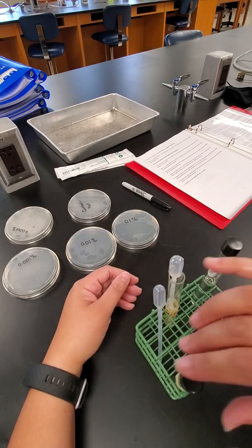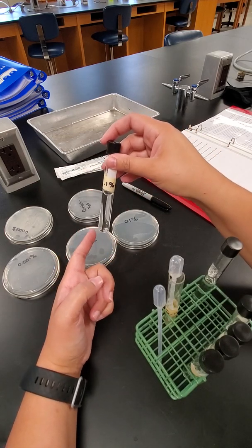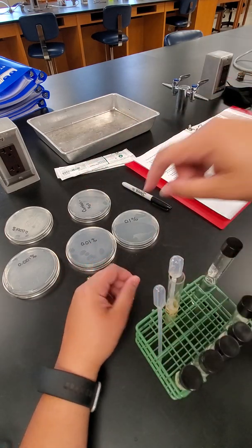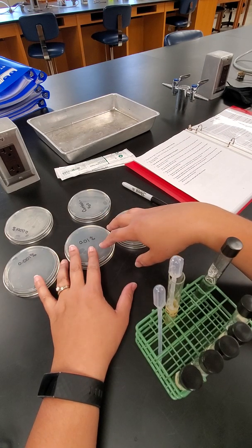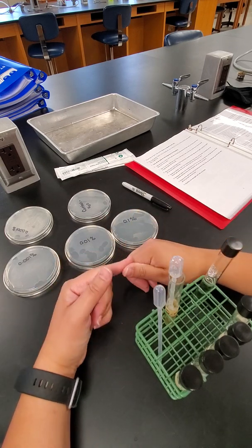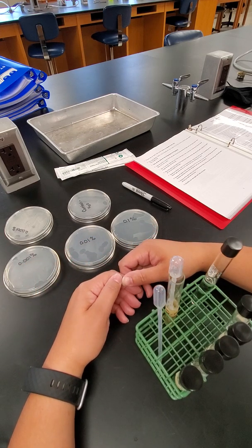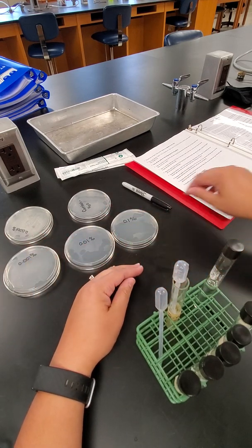But the whole point is that right now we're allowing the E. coli to grow in that bleach solution, and we're going to see whether the bleach solution inhibits some of that growth, or kills some of the bacteria. We'll see that by putting it on the agar plates, putting those in the incubator for 24 hours, and then seeing the results. If there was growth, the bacteria survived and the bleach didn't kill it, and if there was no growth, the bleach solution was pretty effective. Once we're done with all of that, we'll be counting colonies to get the results for our bleach lab.